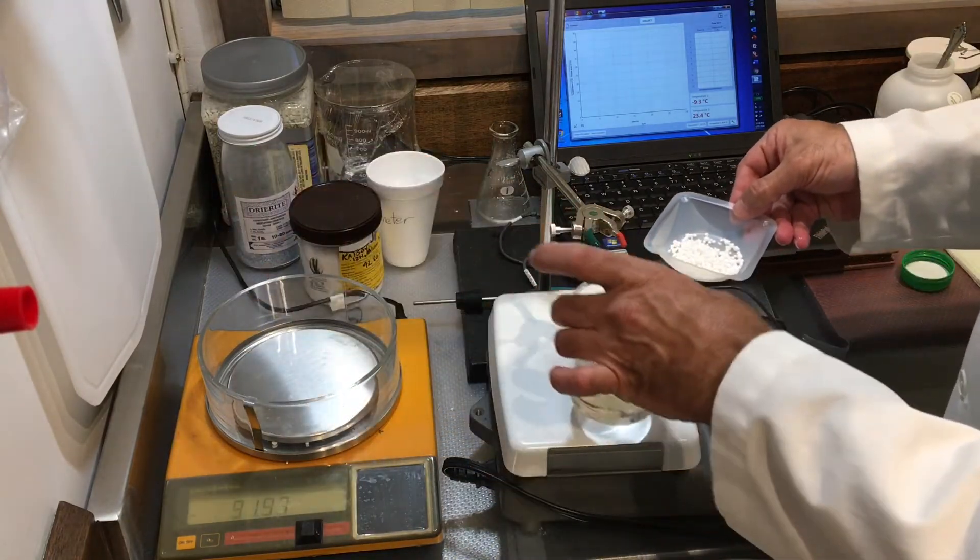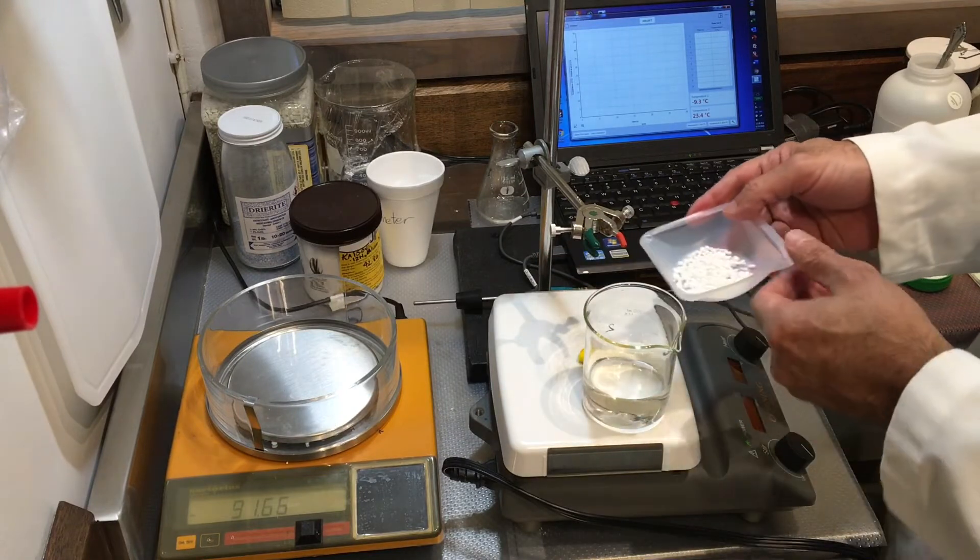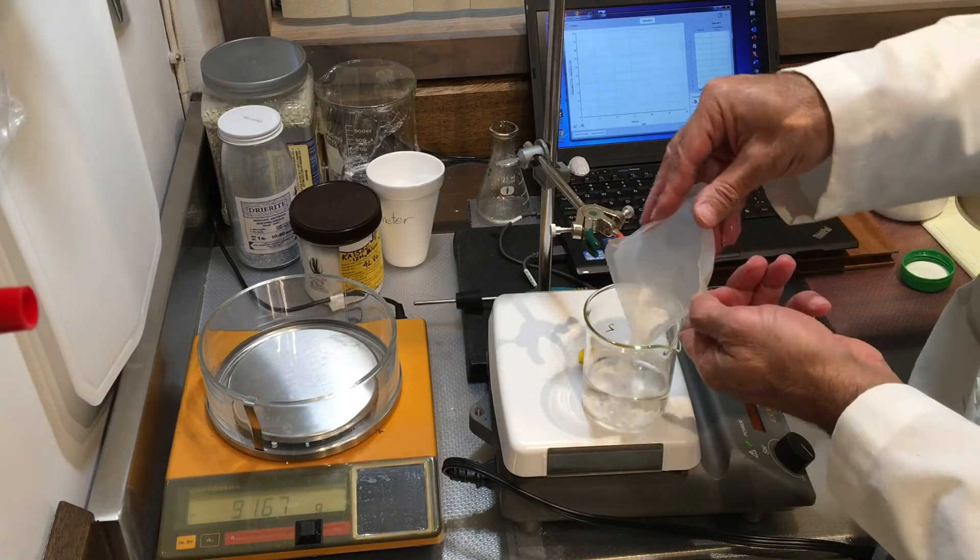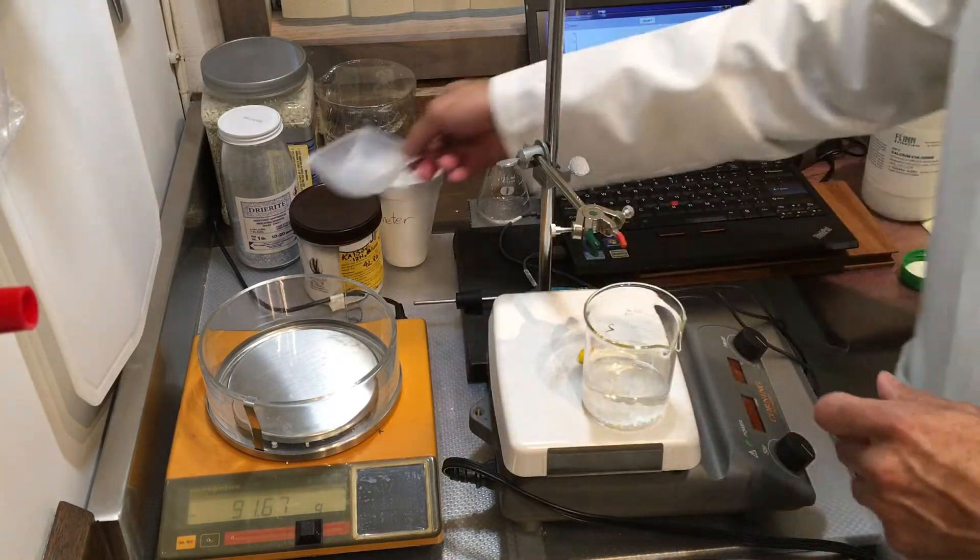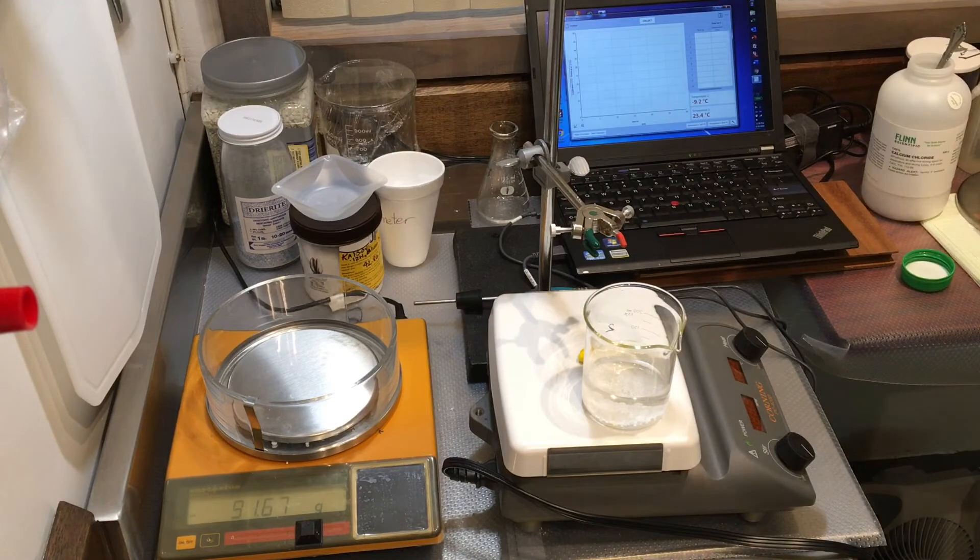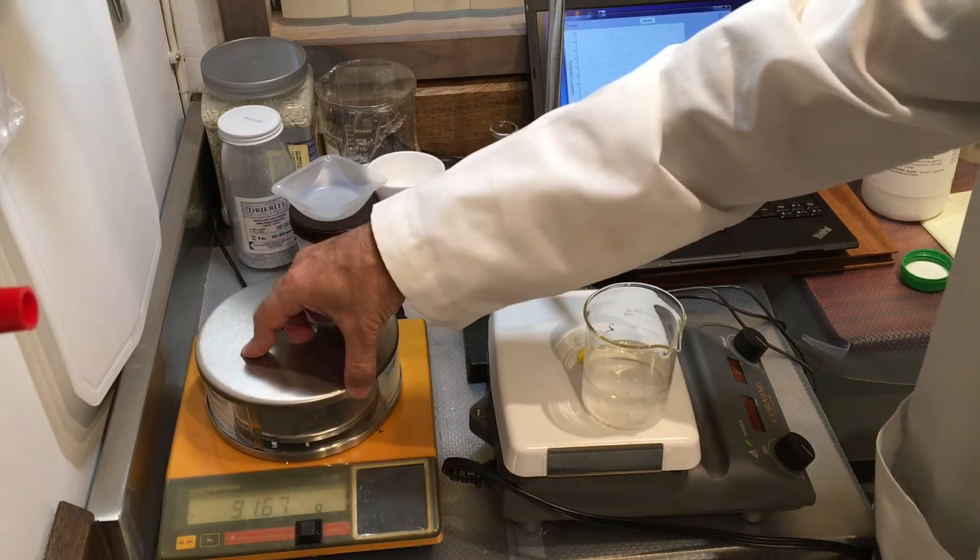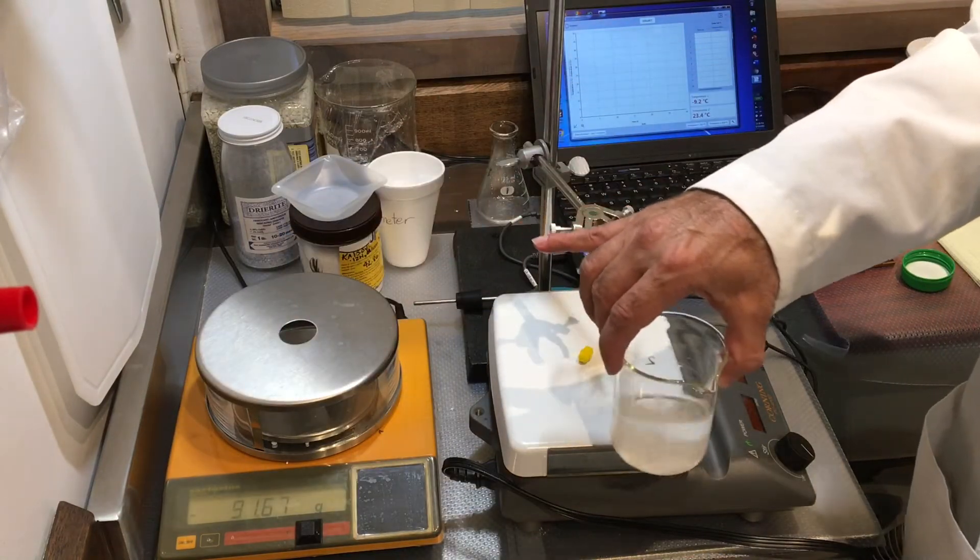Now I'm going to transfer this to my... I'm going to make my solution here now. I have the two masses, so it doesn't matter, there's not much left over here, so we can just let everything dissolve, and we'll mix.